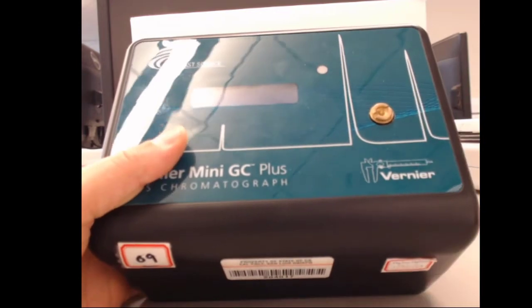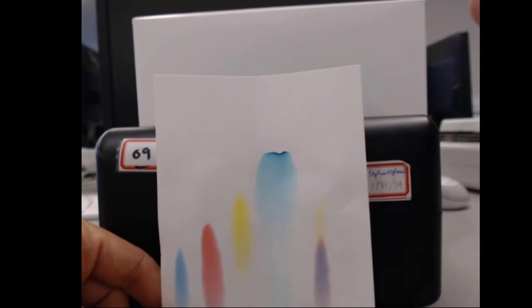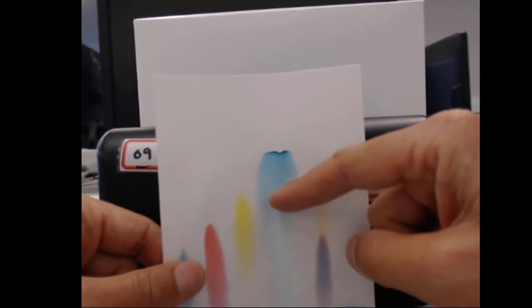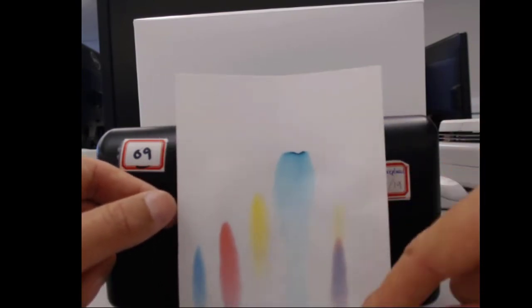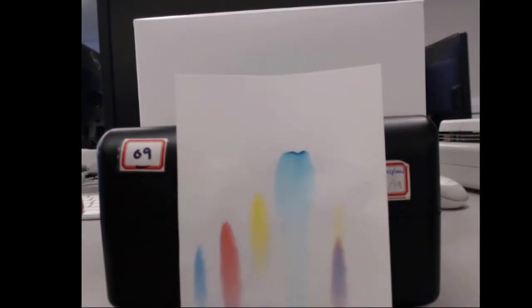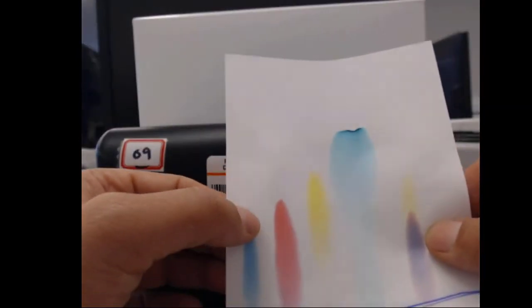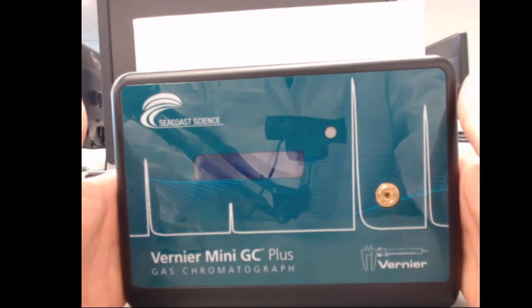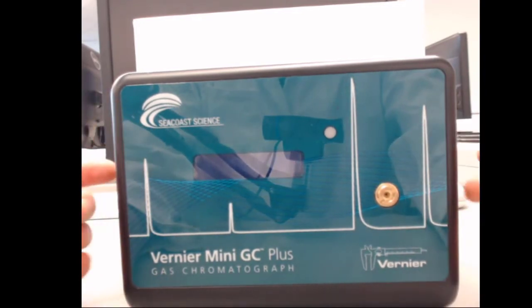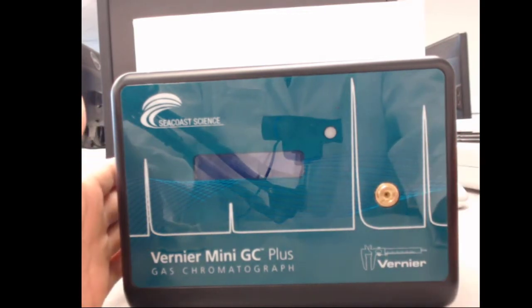And so this allows us to separate out and say, well, how long does it take? If I could rinse water through this continuously, how long would it take to push out the green sample versus the yellow sample versus the red sample? And we would call this, how long does it take, a retention time. So the more that the column holds onto it, the slower that the chemical compound moves through, the larger the retention time, the longer it takes for it to get out. And the more that interaction with the tube, we can tell something about the chemical compound.